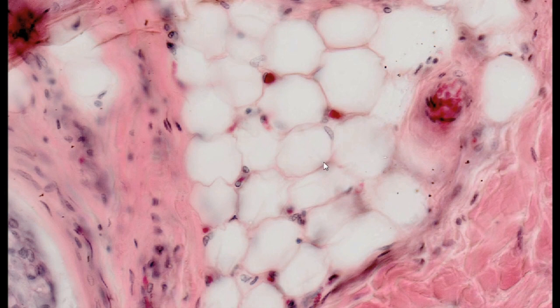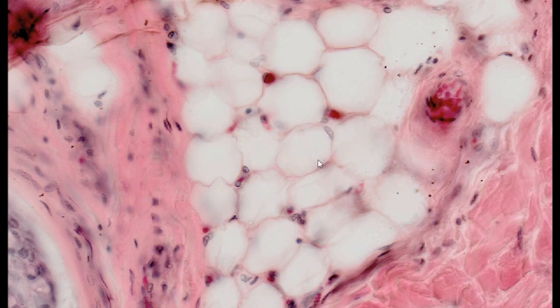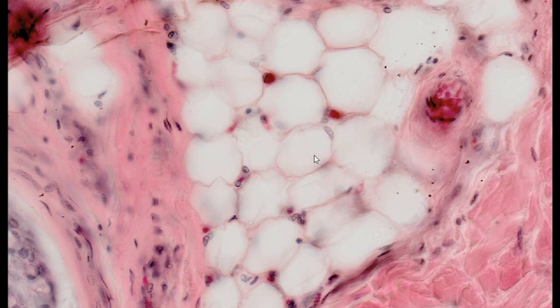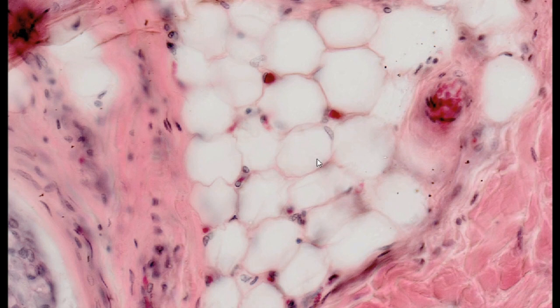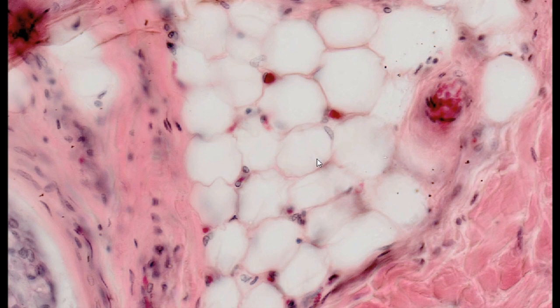In order to make the content of the fat-containing vacuole visible, it is necessary to use fat-soluble dyes, such as oil red.